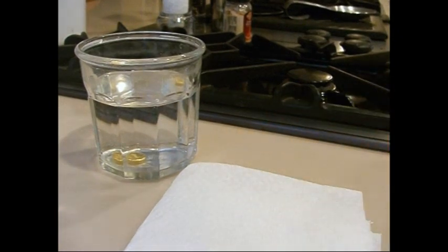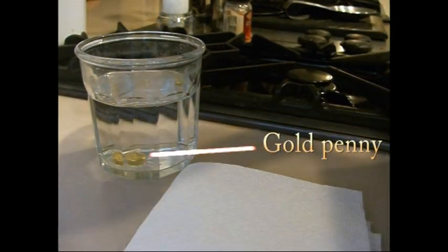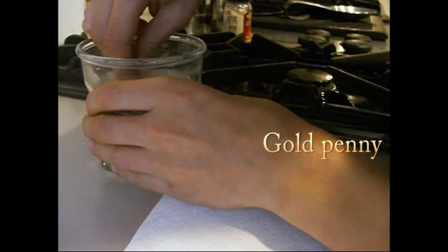Okay, so it worked. I'm going to go ahead and take out the penny that soaked in for a while.